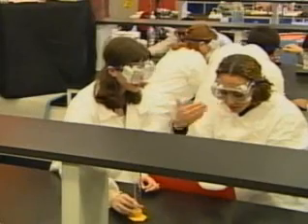Well, I guess those safety goggles really come in handy when you have to get close to the chemicals, like when they have to smell them. Mia, they shouldn't be putting the chemicals that close to their faces. These kids shouldn't smell the chemicals directly anyway. It's a bad move, and it can put you out for the rest of the season. If they've got to smell them, Mia, they should waft the scent toward their nose with their hand. Yeah, like this over here. Just enough to get the scent.